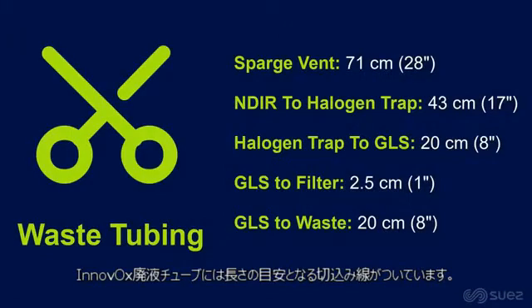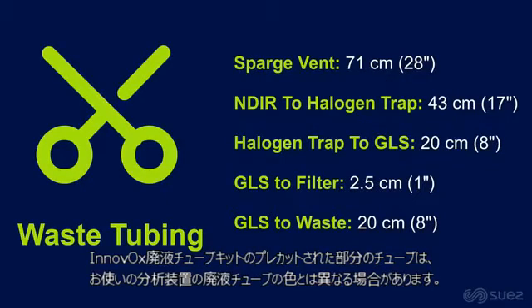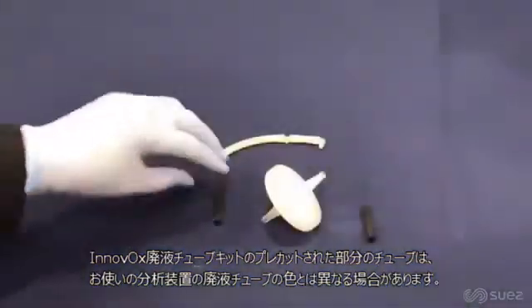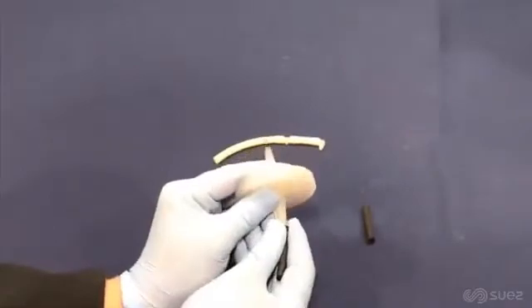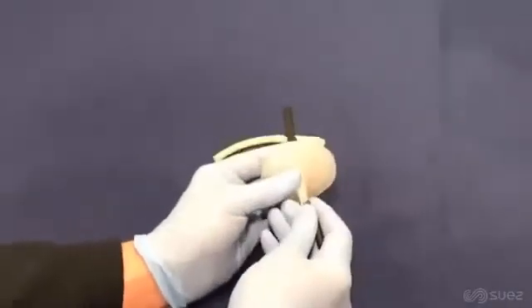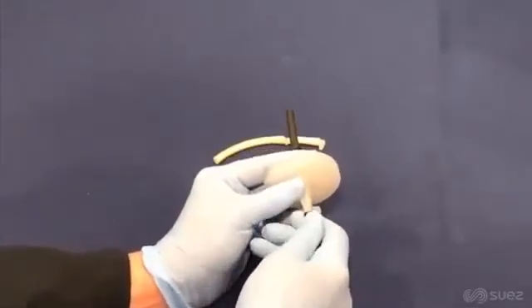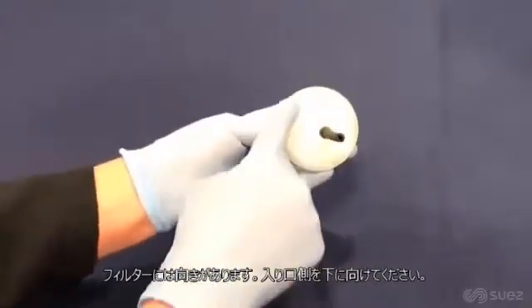The InnovOx waste tubing kit comes with pre-cut sections of tubing specific for each location. As a reference, the tubing location and corresponding lengths are provided here. Note that the pre-cut sections of tubing in the InnovOx waste tubing kit may differ from the waste tubing color present in your analyzer. Assemble the section of tubing containing the NDIR filter. Note that the filter is directional, and the inlet needs to be facing down.